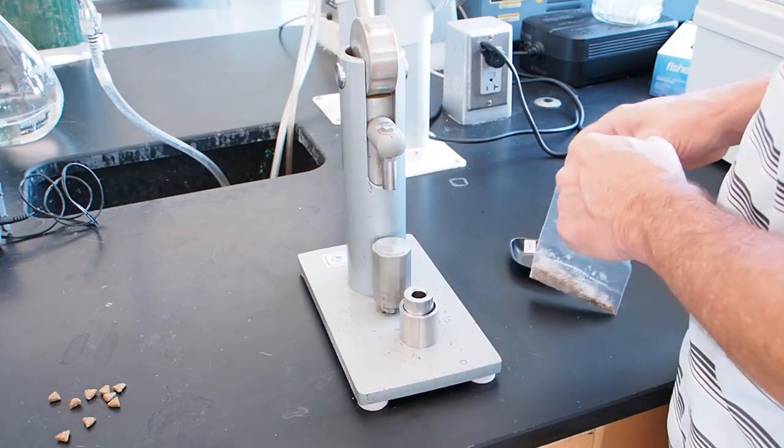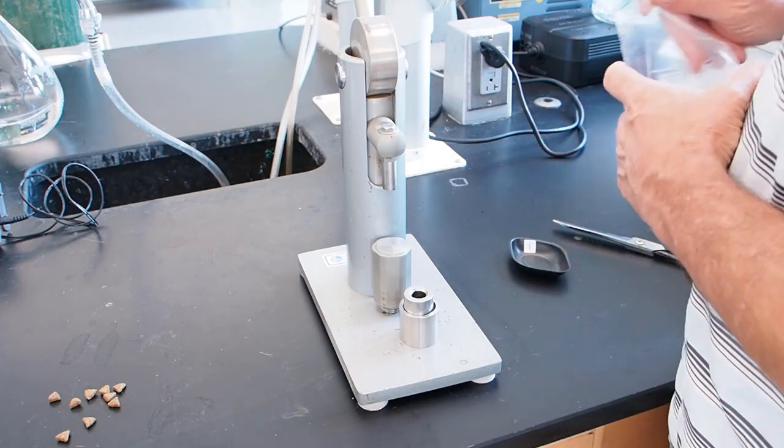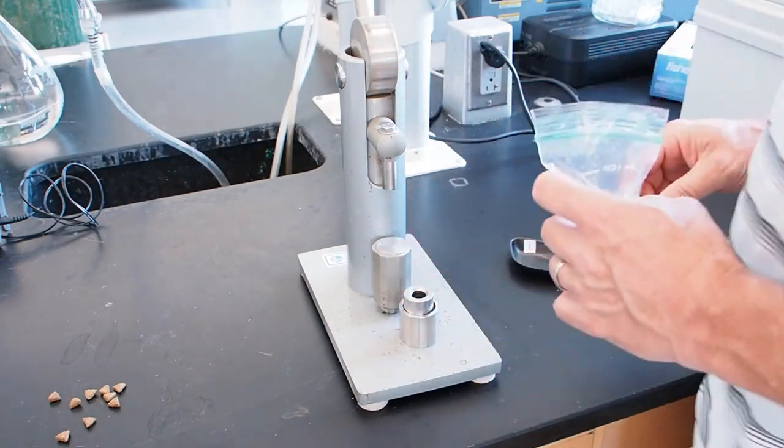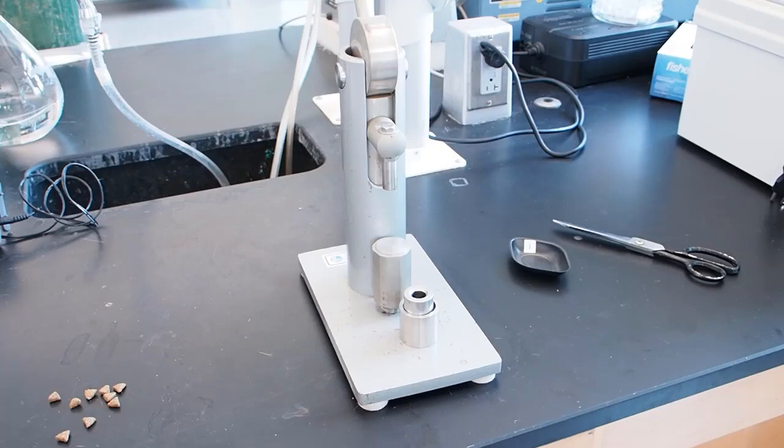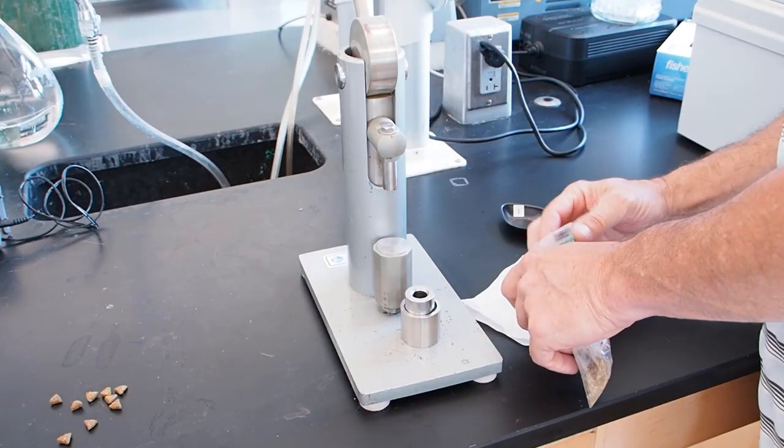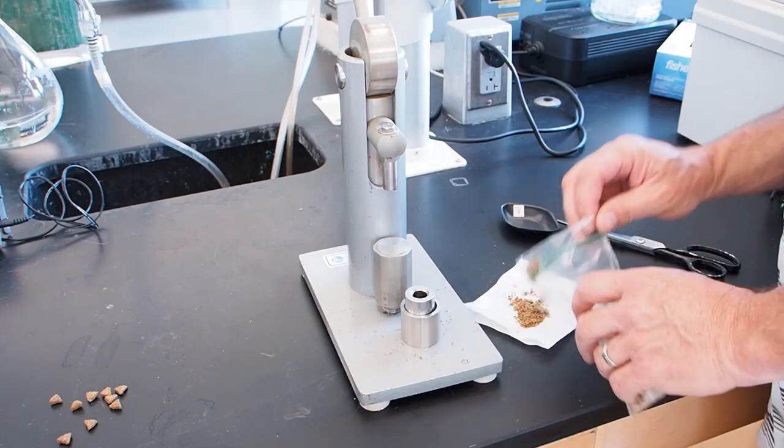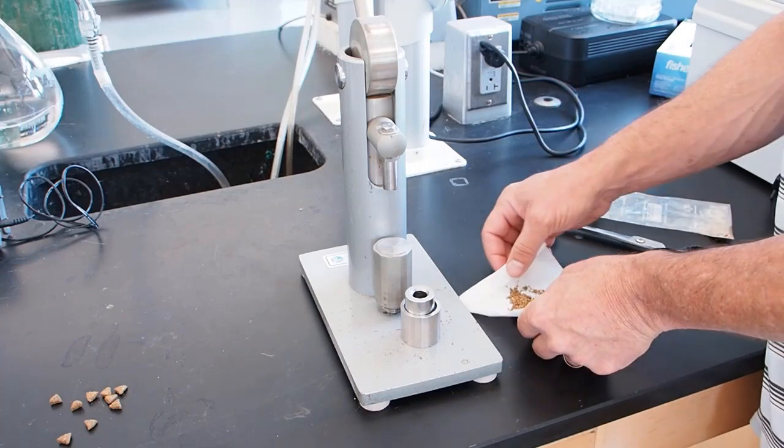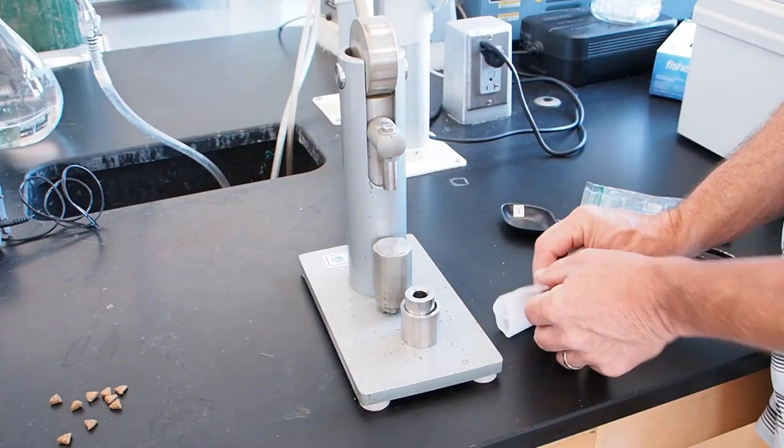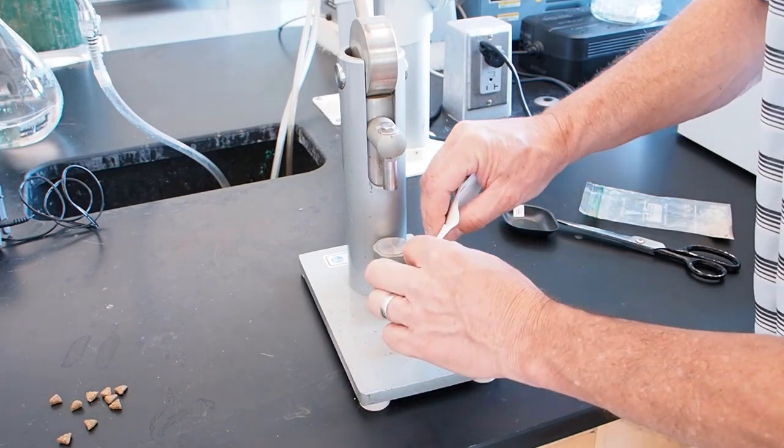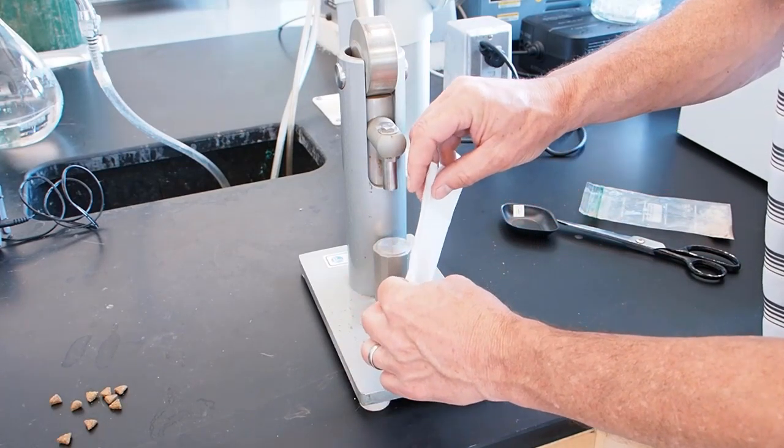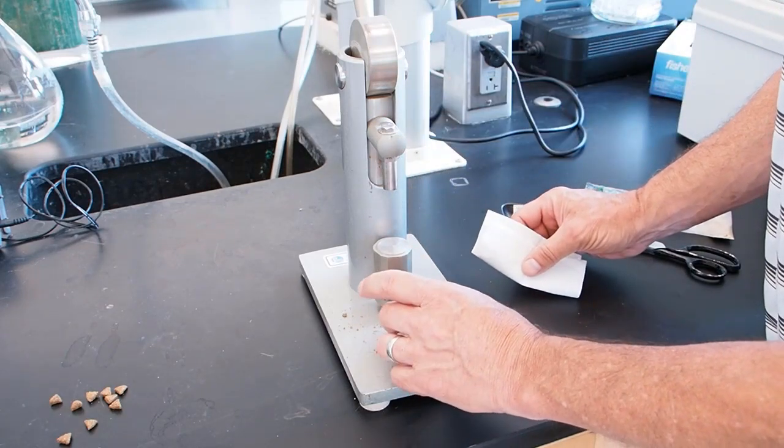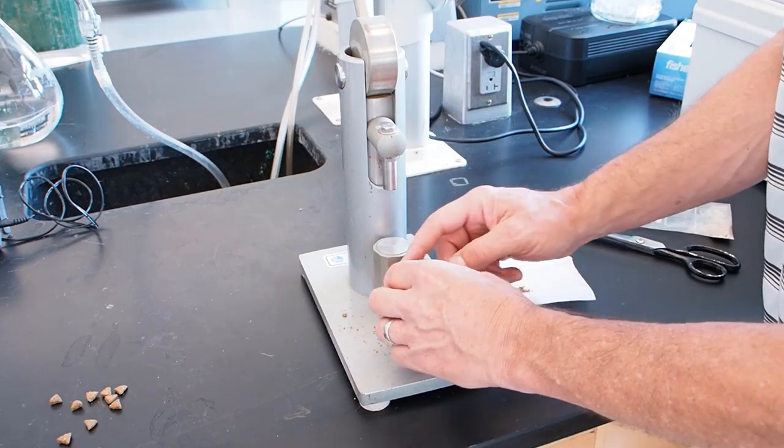So we're going to take this here, and we're going to take this and pour it on a piece of paper and use the paper to kind of funnel it in there. Smells like dog food. Okay, let's pour that into there. Oh, that's a lot. Yeah, just a little. Lost a little, but that's okay.